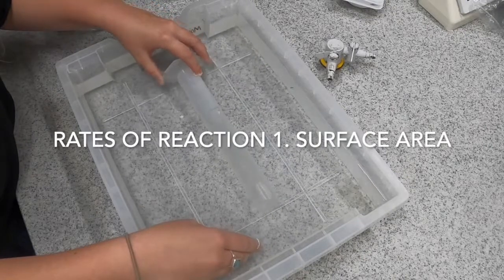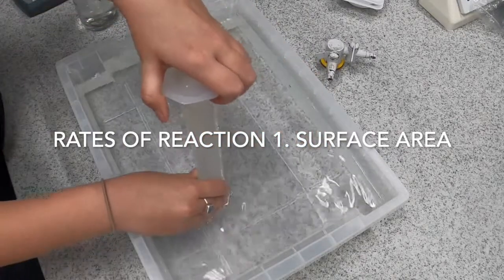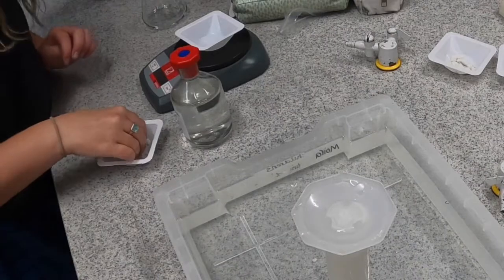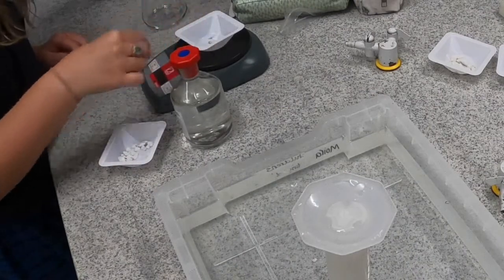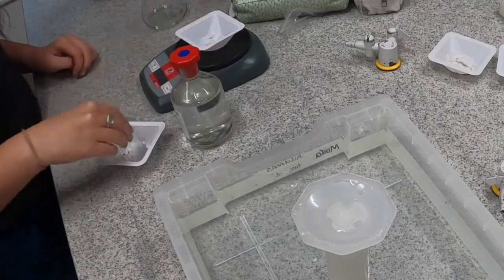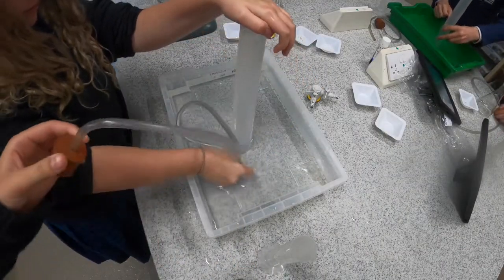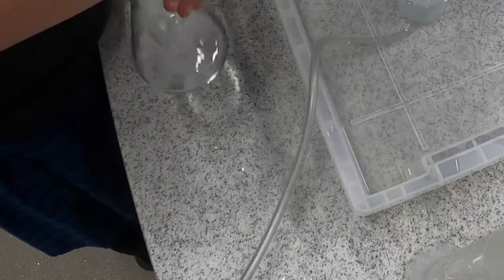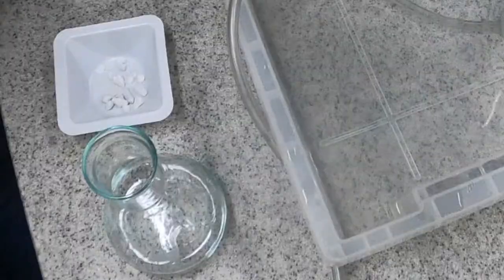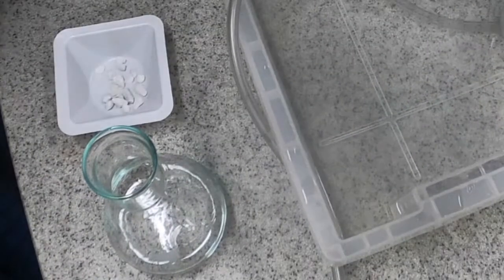This is the first practical looking at rates of reaction, and this is surface area. So the whole principle of this is that we're going to produce some gas through a chemical reaction. We're going to produce carbon dioxide by reacting calcium carbonate and hydrochloric acid together in a conical flask. Then we're going to deliver the carbon dioxide through a delivery tube to displace the amount of water in a measuring cylinder. So here we've got small chips.